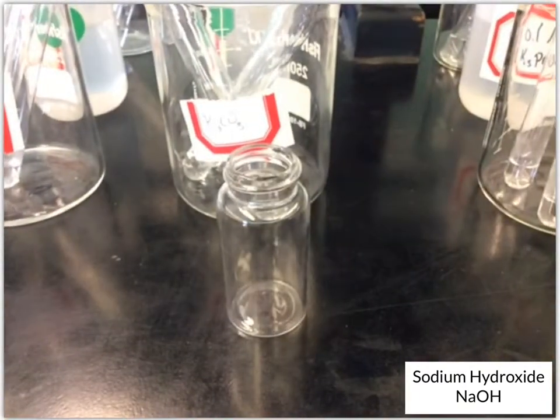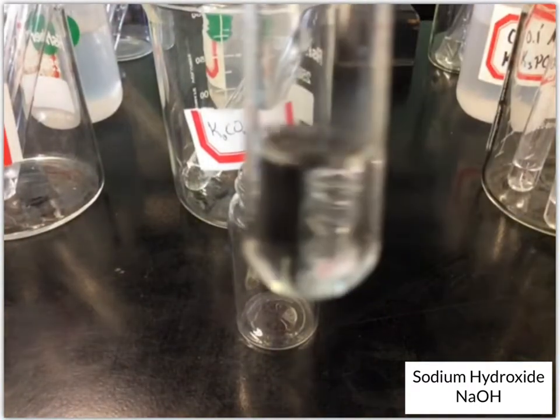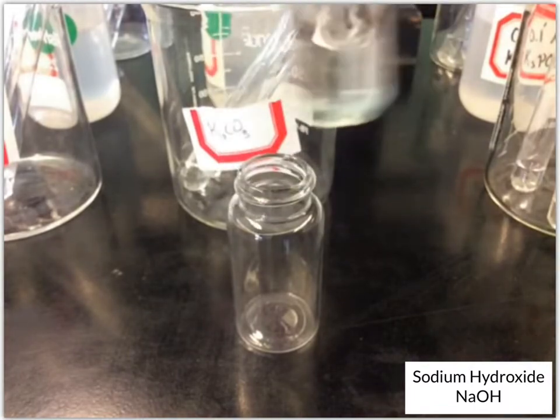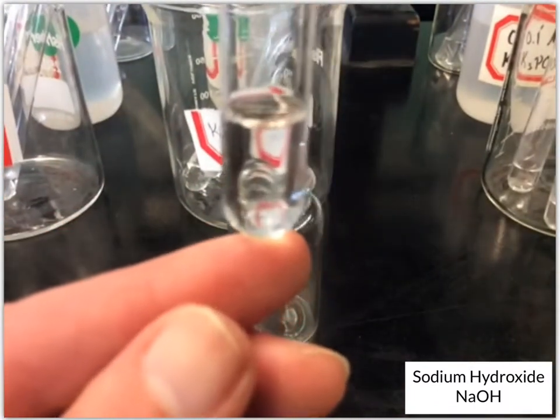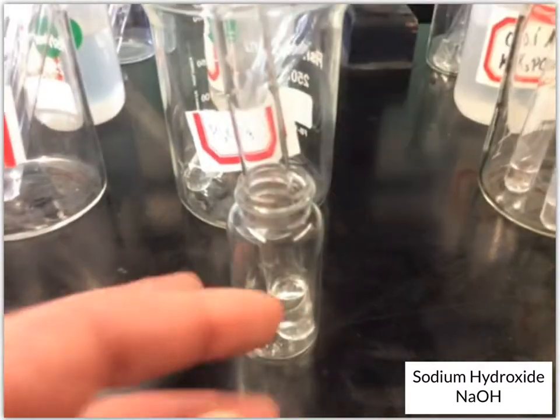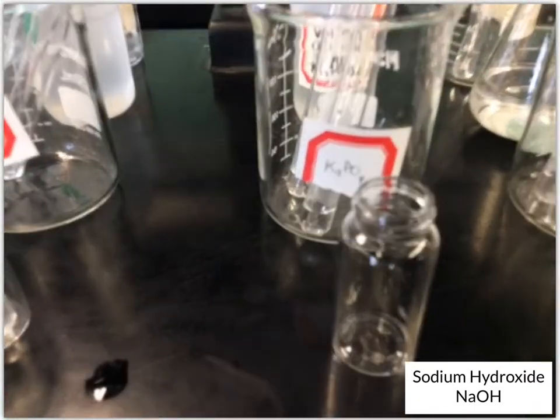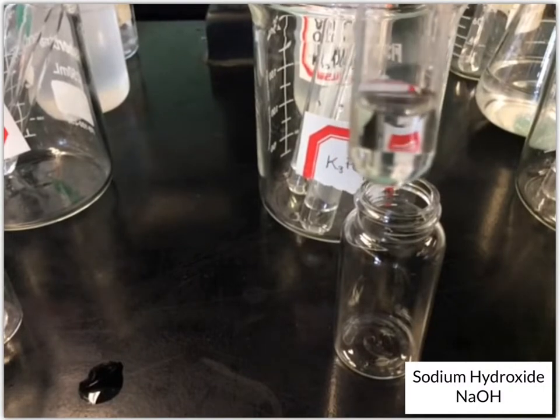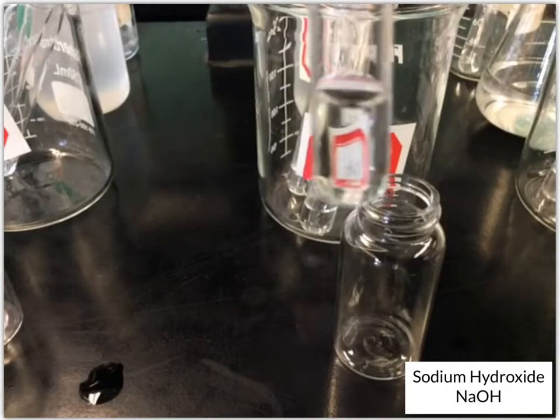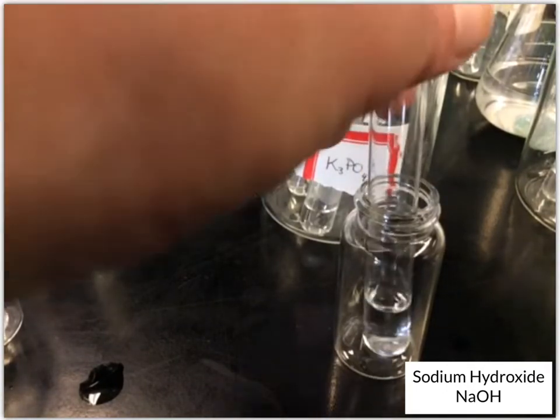Okay, next up, potassium carbonate. Doesn't look like anything happened. It's just a clear solution. Okay, next up, potassium phosphate. Okay, also just a clear colorless solution, so no change.